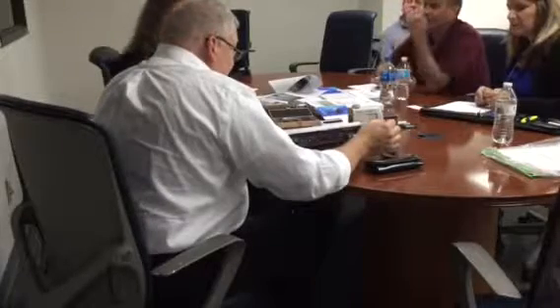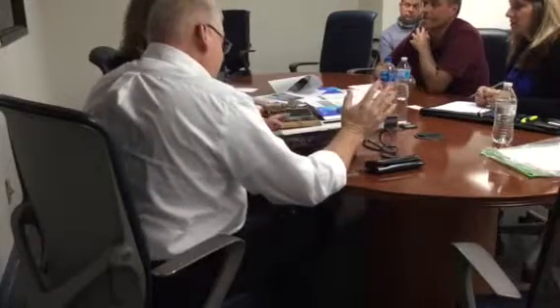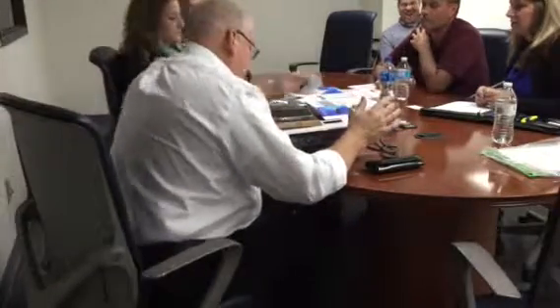I can show you the tilt if you want, it's no big deal. It's pretty exciting stuff. It's actually in the manual also.